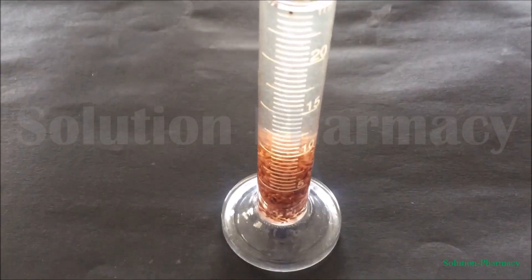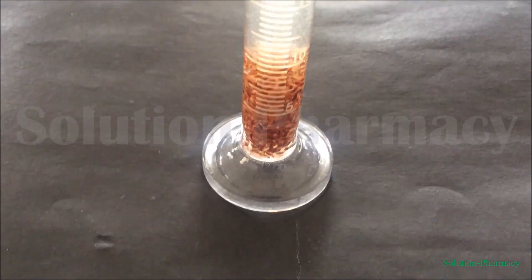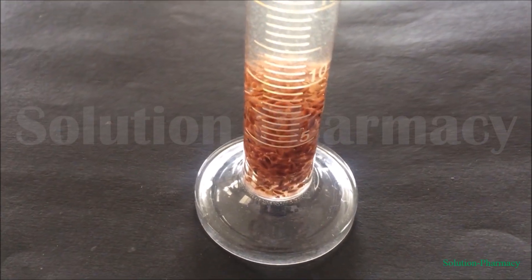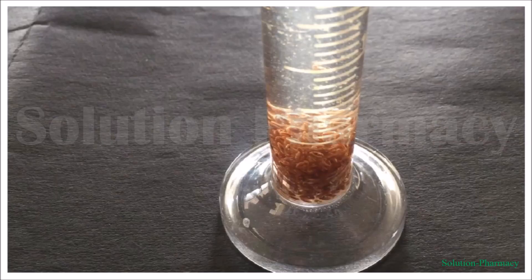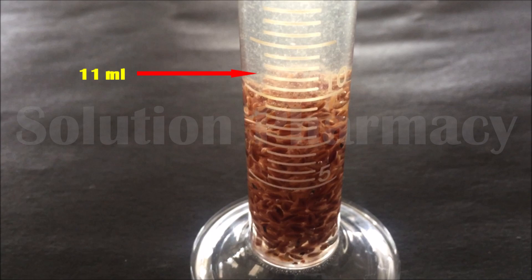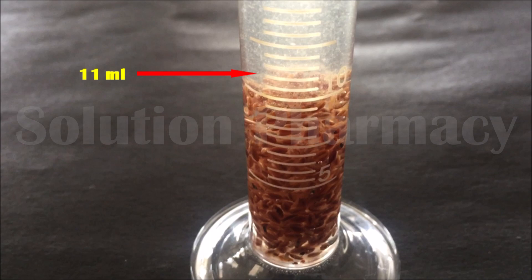The swelling index is a criterion used to check the purity of the drug. The quantitative swelling of the drug is due to the mucilage present in the drug. Here you can see and compare the volume of the drug occupied before swelling and after swelling. Measure the volume occupied by the seed including mucilage after swelling.